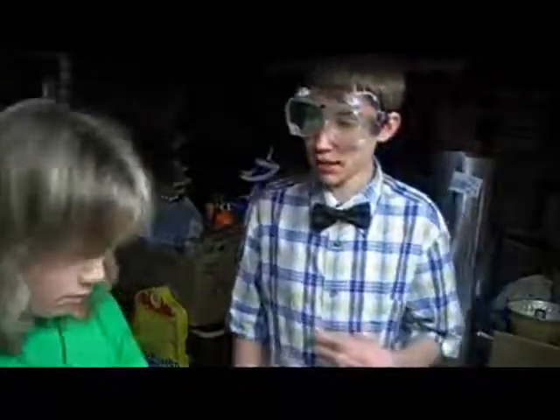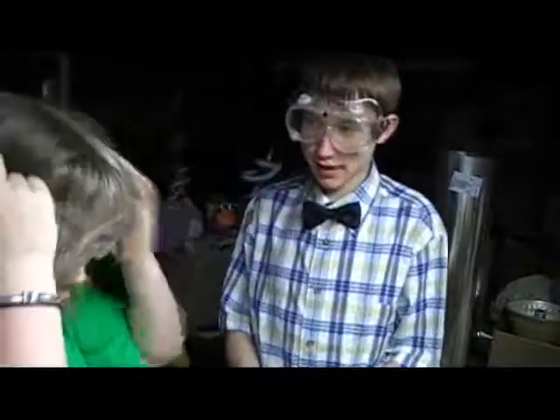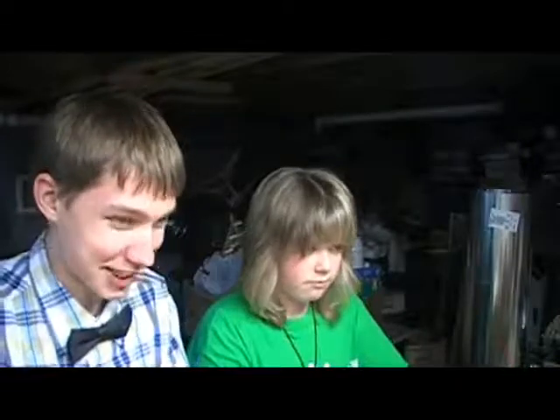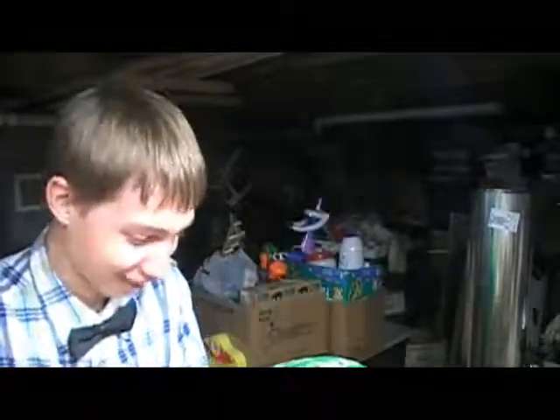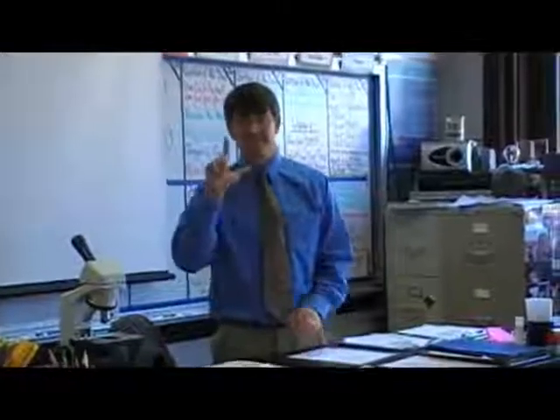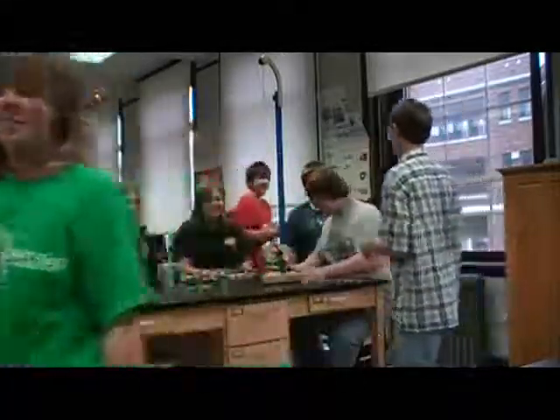In my part of the book, it said, don't take your goggles off! Am I part of the book? Oh, snap! That made it worse. Check for chemistry safety 101. What did I do wrong? That was part of the book!